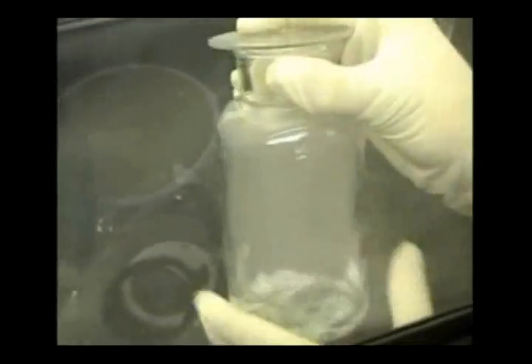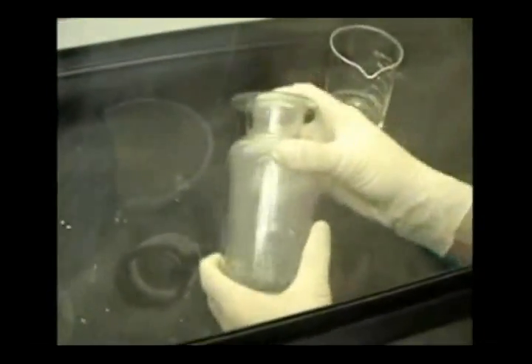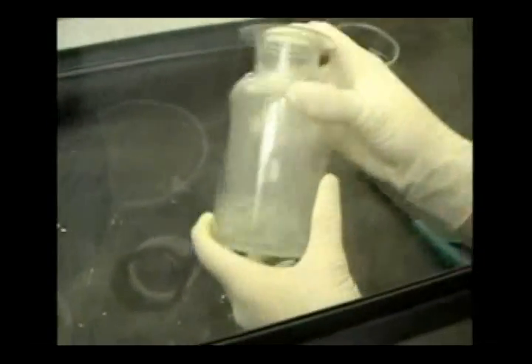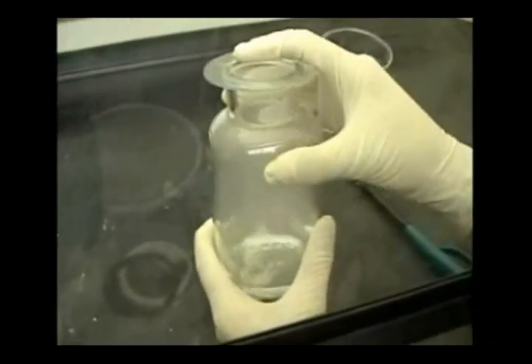While making sure to hold onto the cover glass entirely, so no SO2 escapes. The SO2 and water react.